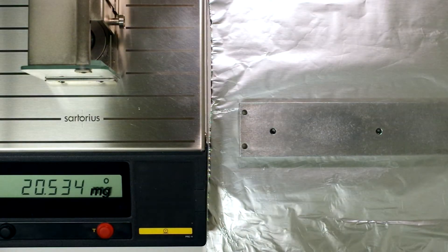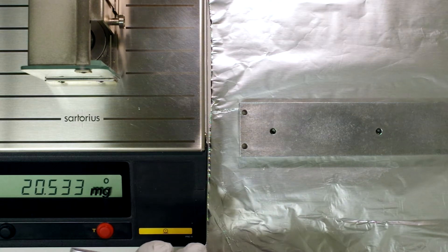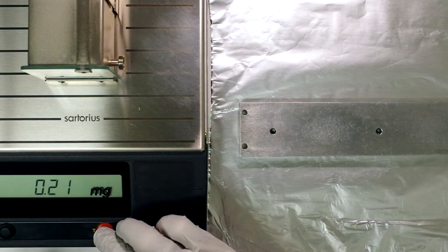In this video, I'm going to show you how to weigh out very large amounts of sediment. I'm going to use an 8x5 tin capsule. I'll put it on the balance and tare it.